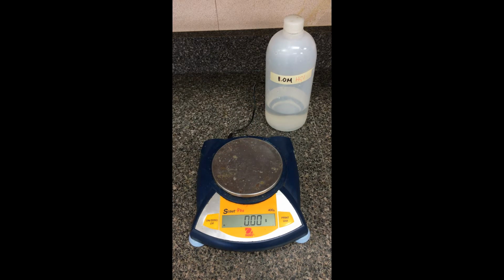How we're going to be measuring the rate here is we're going to take 1 centimeter portions of this magnesium ribbon. Whenever this 1 centimeter portion is completely consumed, we're just going to take the total time for that. Because I'm going to know the mass of this 1 centimeter increment, if I can divide that mass by the time, that's going to overall give me the rate.